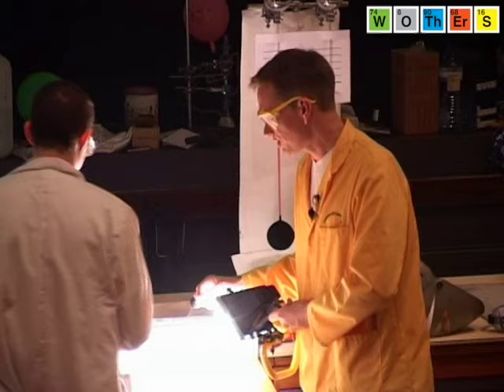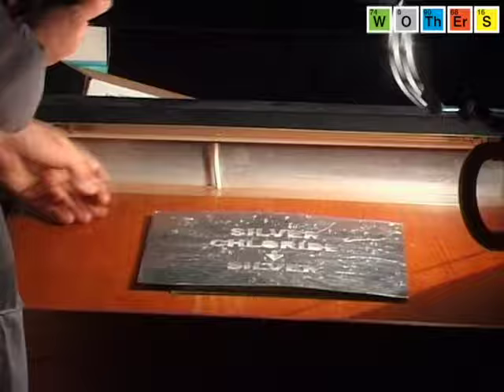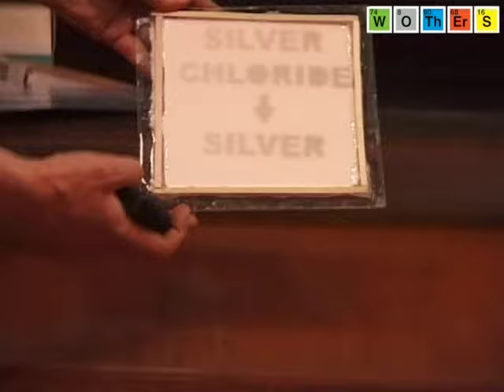So, let's try this. And if we hold this up, we should be able to see here — there we are. Silver chloride going to silver. And this reaction is brought about by the light energy.